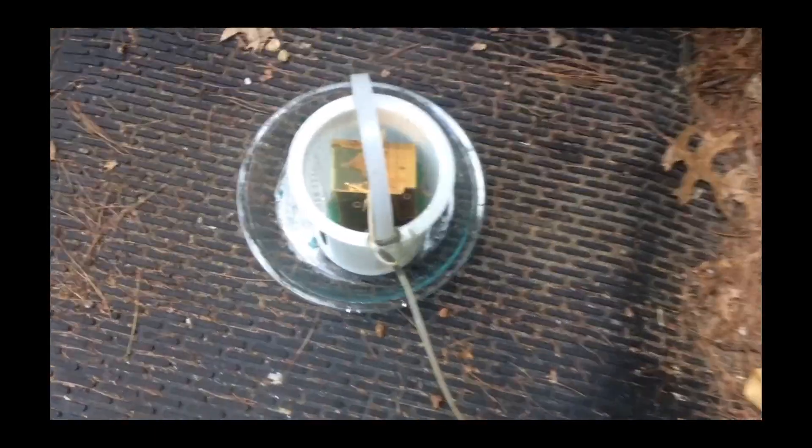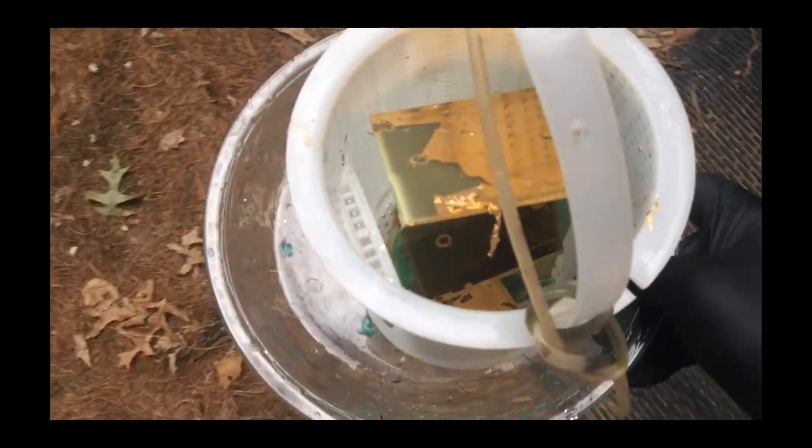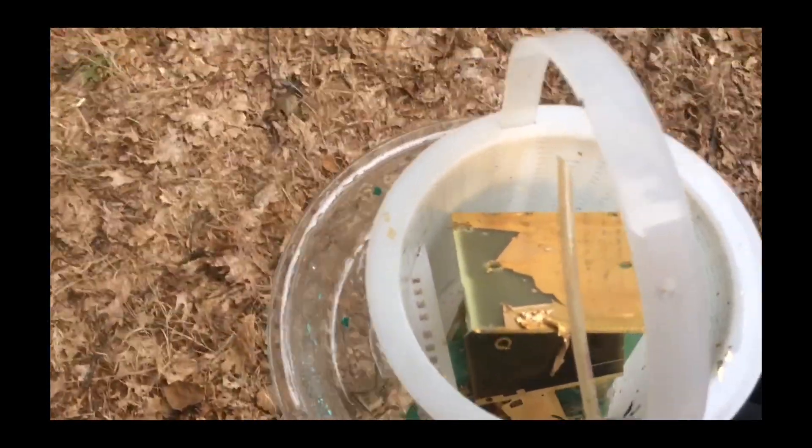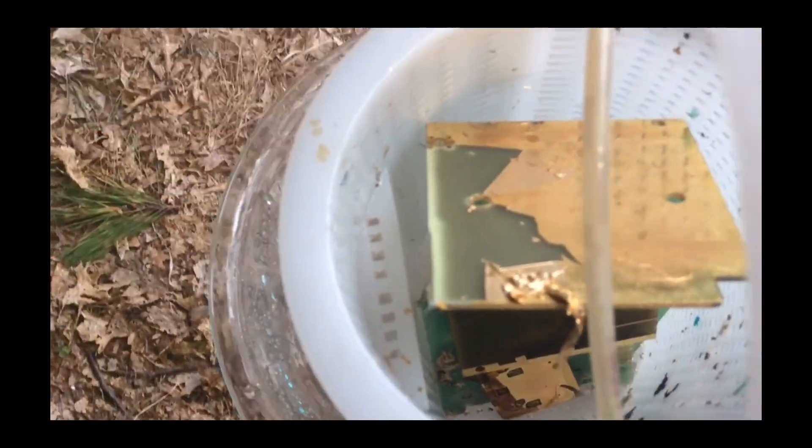I'm going to now carry these over to my work table. We'll spread them out and we'll look at them first hand. Notice how I have a Pyrex glass underneath it to catch any drips, although it has been draining for about 30 minutes.